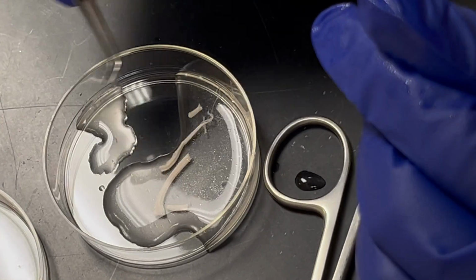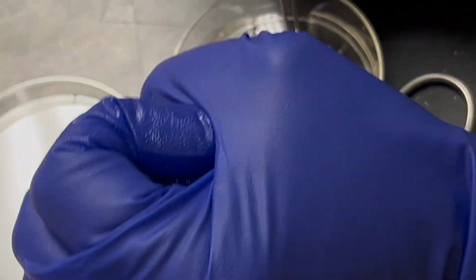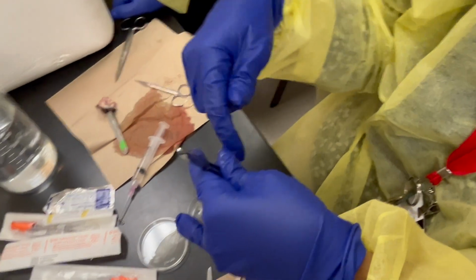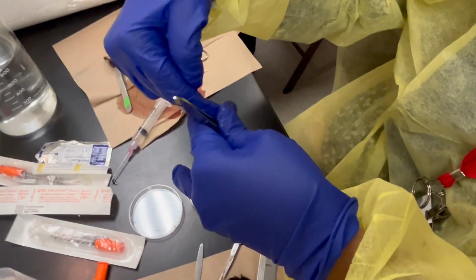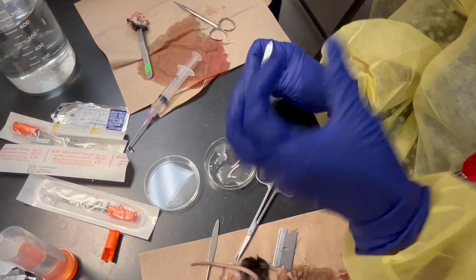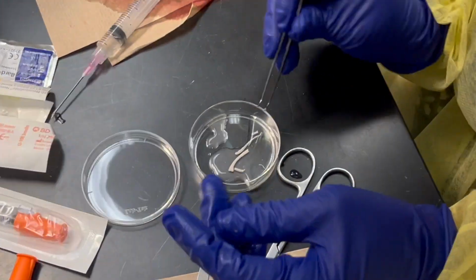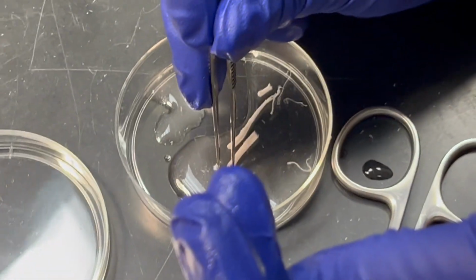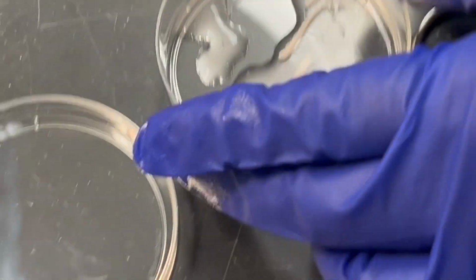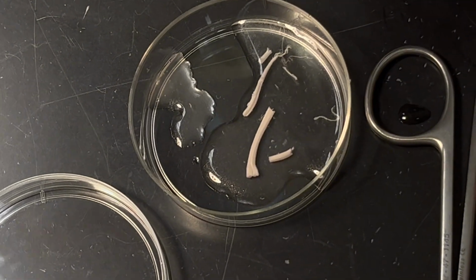So basically what happened when it was breaking is why the pressure needs to be perfect. If this is a column, and there is more pressure on one side, this part came out before the whole part came out, and that's when it gets broken. If the pressure is equal, the whole thing comes out straight. But like you said, the easiest way to find where things are is this very white pale line that marks the dorsal part of the spinal cord.